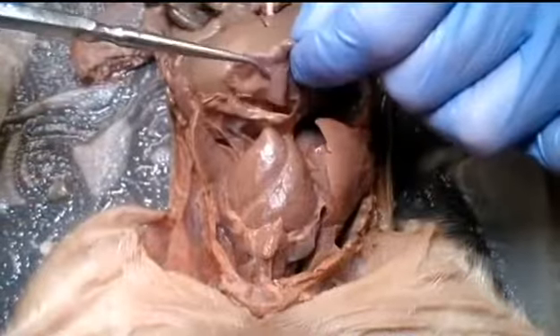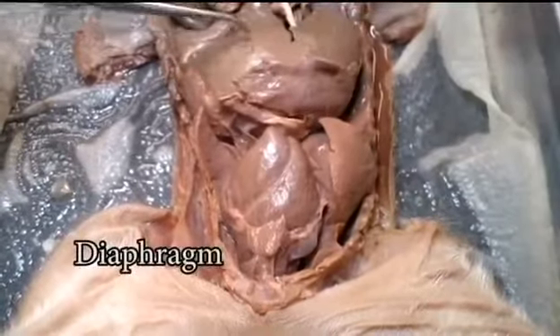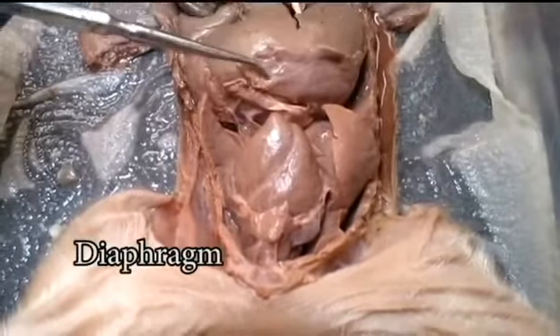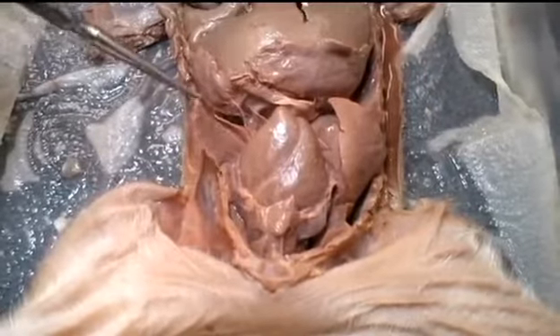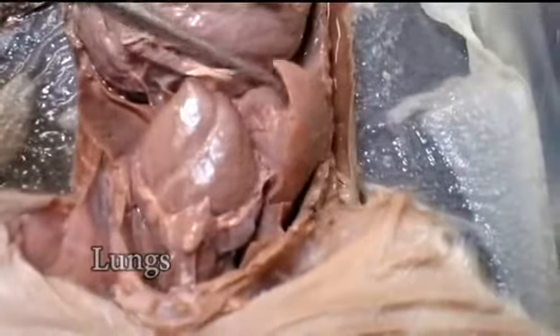This is the diaphragm, superior to the liver. Let's move up to the left lung — you'll see the different lobes. And the different lobes of the right lung as well.